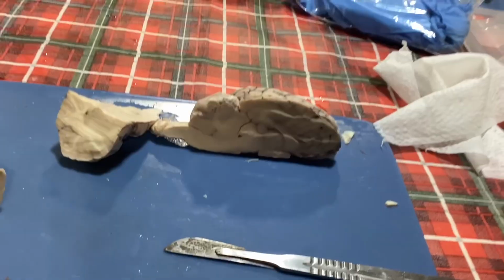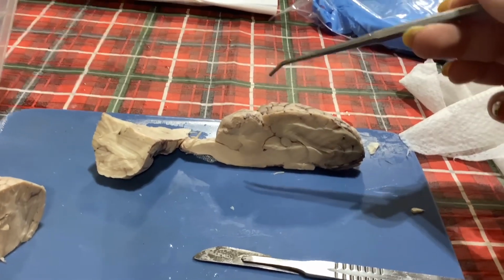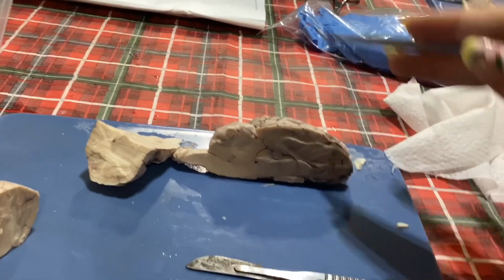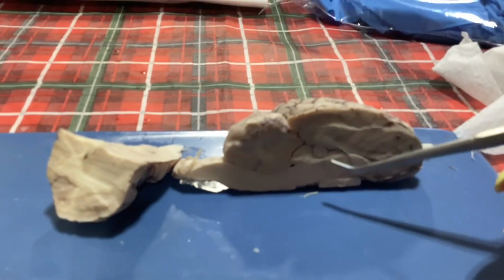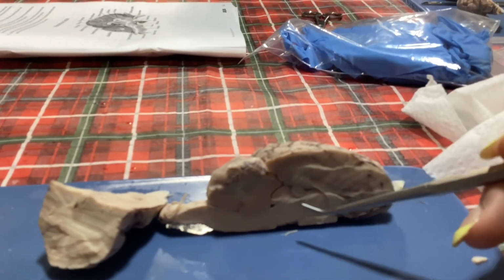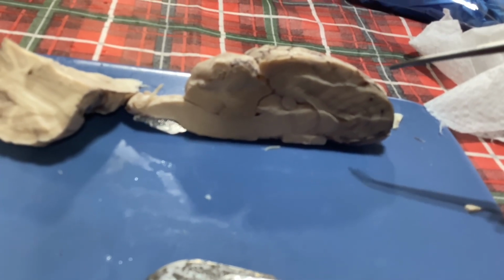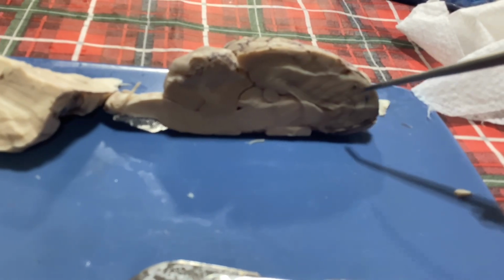Our optic chiasma is going to be where our cranial nerves are. So it's going to be the top point, but then they go this way and that way, and they connect to our eyeballs. All right, and then we'll have our pineal body, which is going to be this little ball right here. And then our thalamus is going to be right here, down here. Then after that, we have the sulcus. The sulcus is going to be this little vein right here in front of the gyrus.